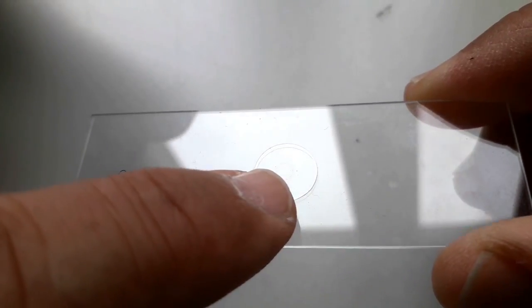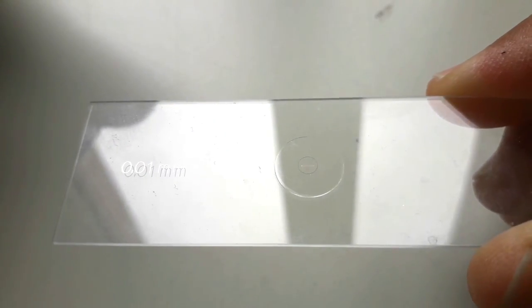So now let's determine the thickness of the spider's silk. In order to do that, I used a micrometer slide. The micrometer slide has very small engravings in them, and in this case the distance between two lines is 0.01 millimeters.